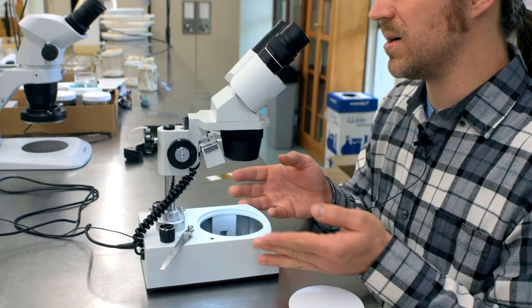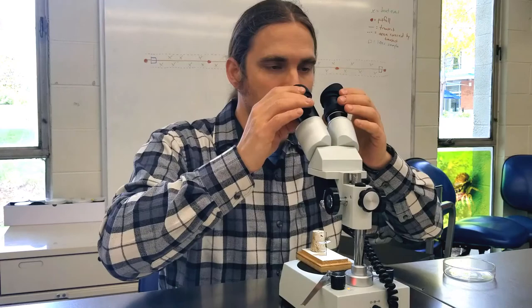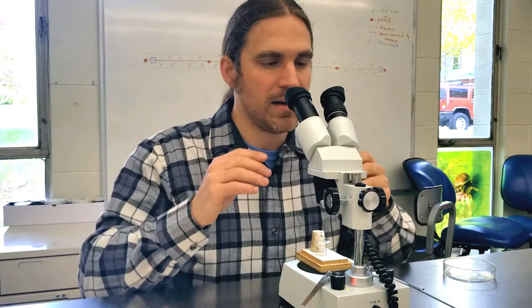Some microscopes come with rubber eyepieces that can be put onto the eyepieces as options. When you look at the scope, they're supposed to help keep light or distractions from coming in from the side. I find them difficult to use, so I typically work without them, but if you find they help you, you are certainly welcome to use them as well.